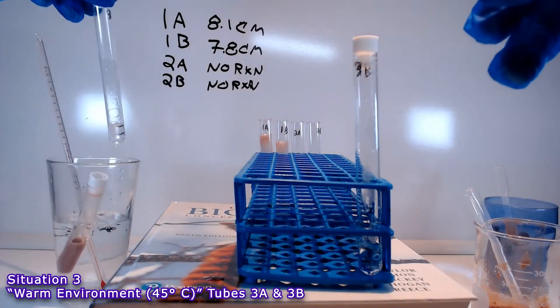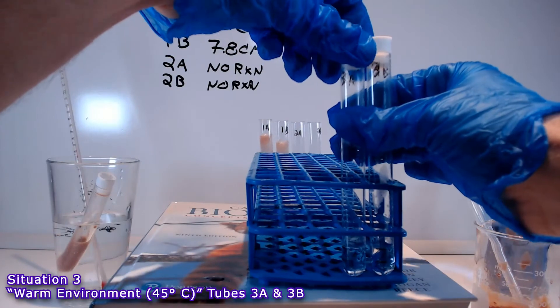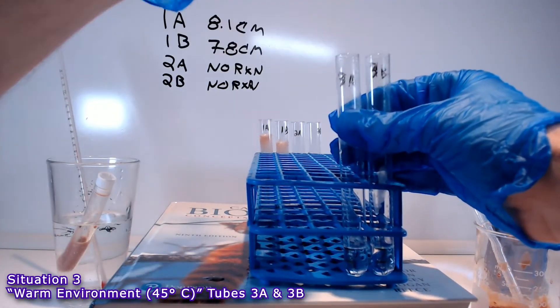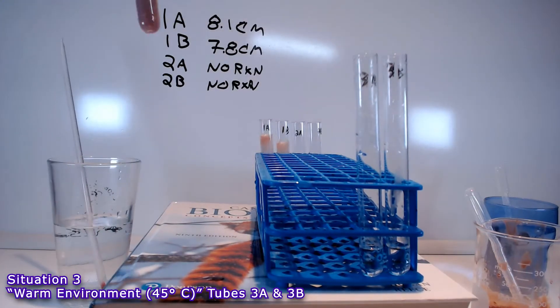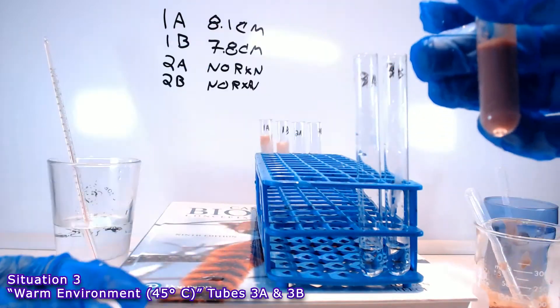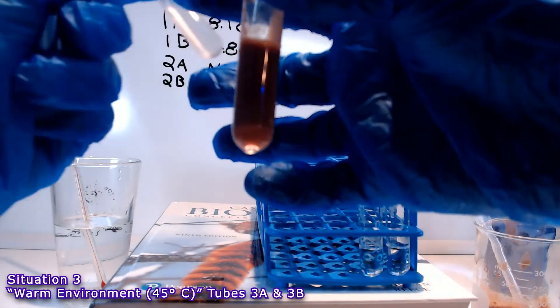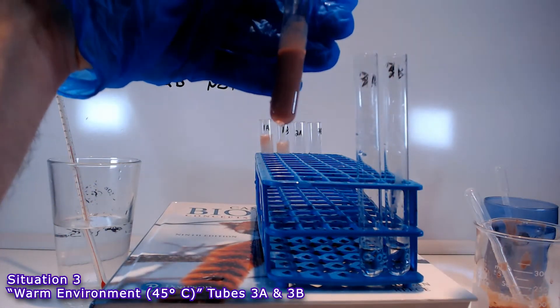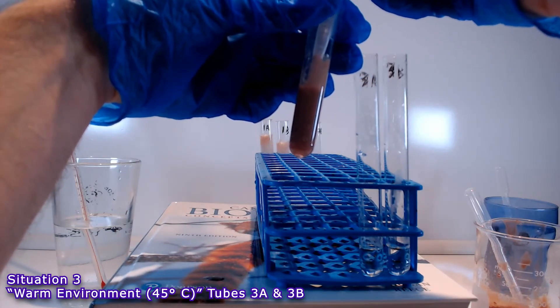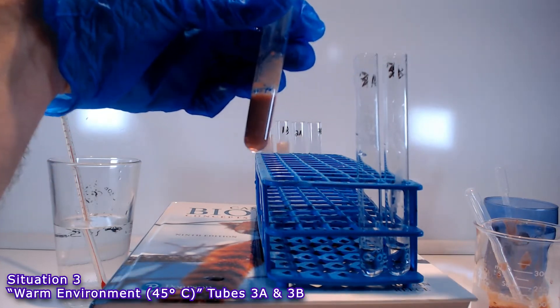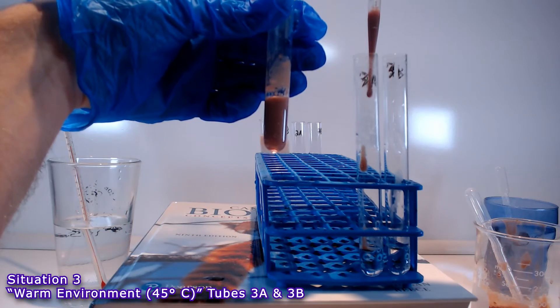How might that affect the activity of catalase? One thing you might notice is that I am using slightly larger tubes here. The tubes are the same diameter. So the results in terms of the height of the column of bubbles will be the same. They will be comparable to the other tubes. I just wanted to prevent the possibility of the bubbles overflowing onto my desk. I wanted to make sure that we could record the results.